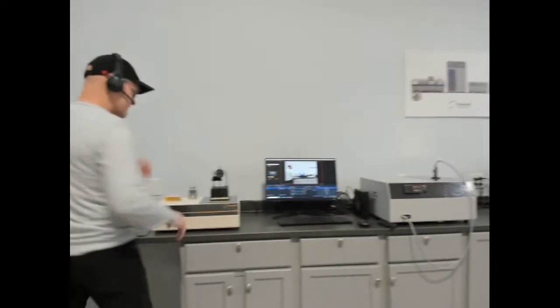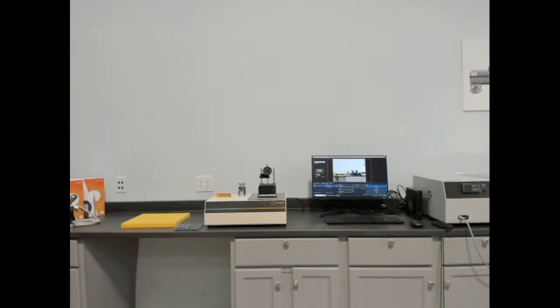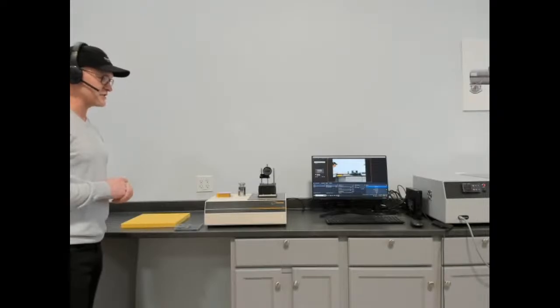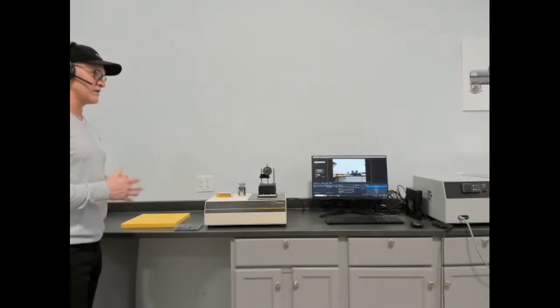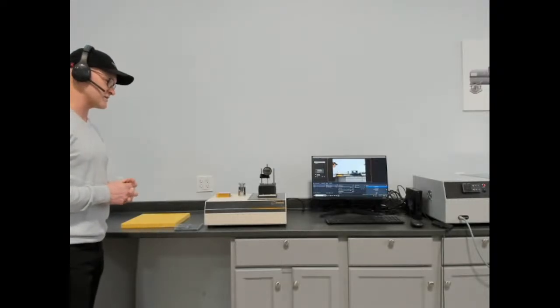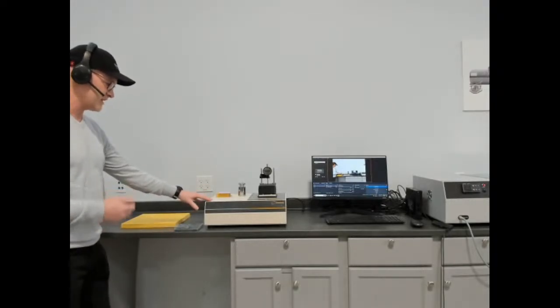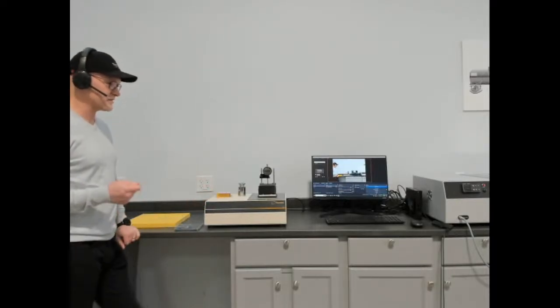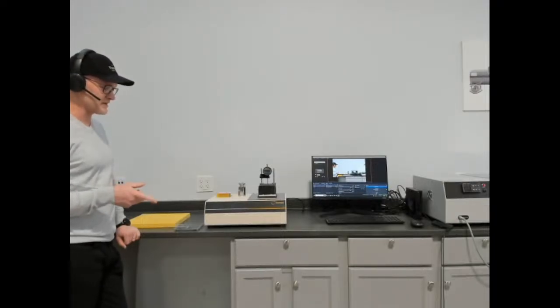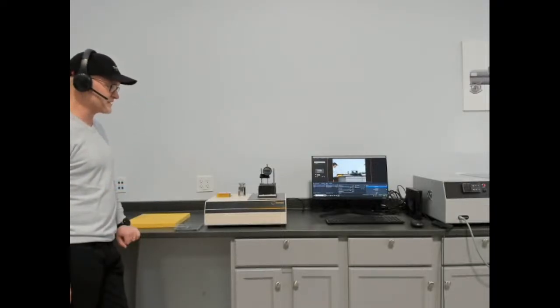So why did we design the HFM-25? We designed this to measure small format insulation. Very often transient methods get used for measuring complex insulation type materials, high porosity, large pores, a large degree of heterogeneity, where in some of those, or many of those situations, thermal resistance and thermal conductivity via ASTM C518 is the preferred method. And most of the time we weren't able to do small format insulation because of the minimum sample size required for the classic heat flow meters.